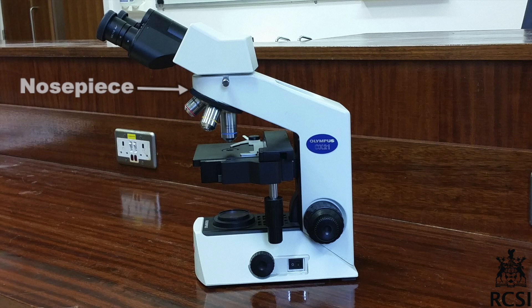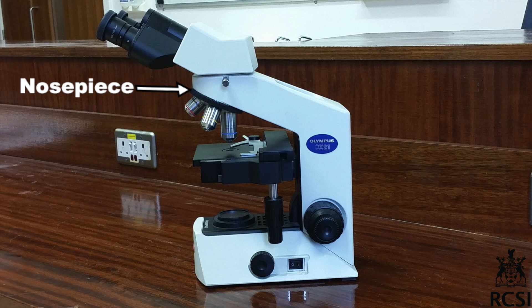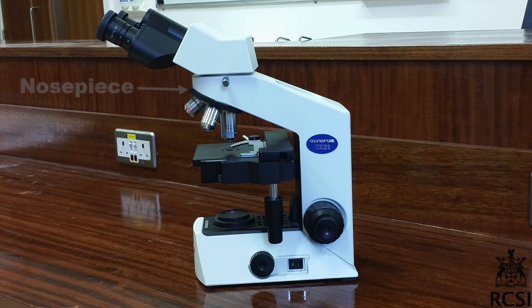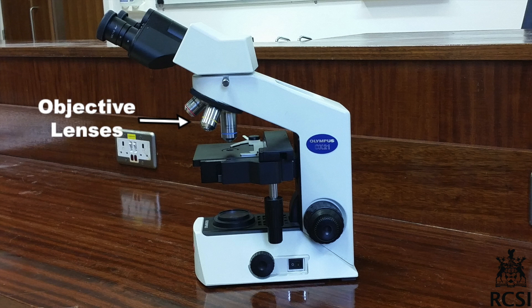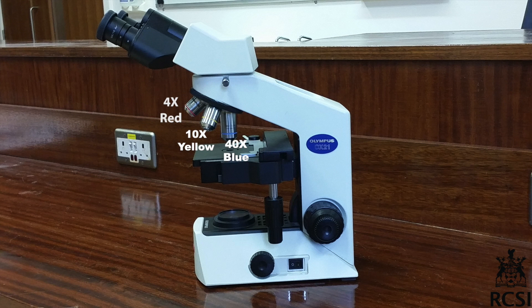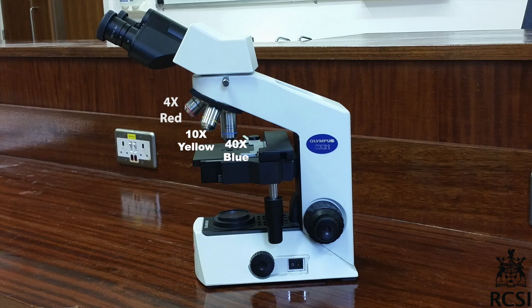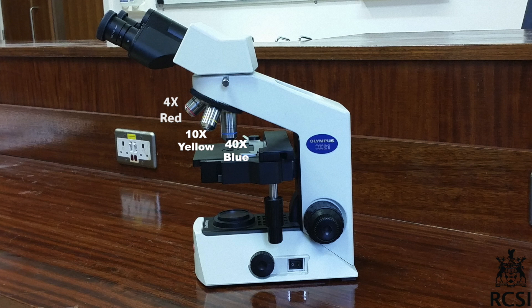The nosepiece holds different objective lenses and allows the rotation of the lenses while viewing. There are three objective lenses found in a microscope with ranges of 4x, 10x, and 40x powers. Lenses are color coded: the shortest lens is the lowest power and it is red, and the longest lens is the highest power and it is blue.